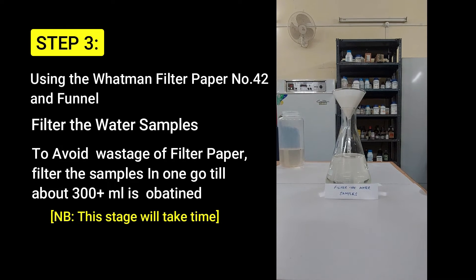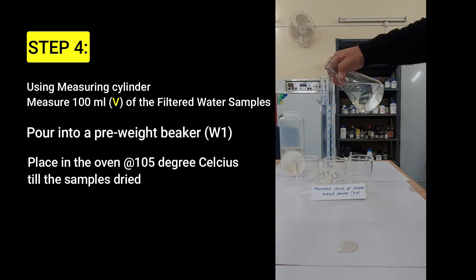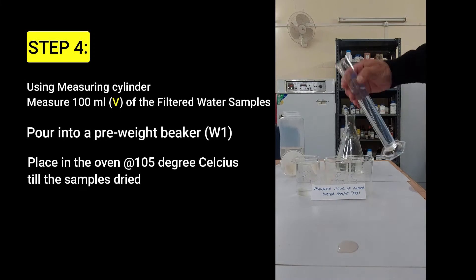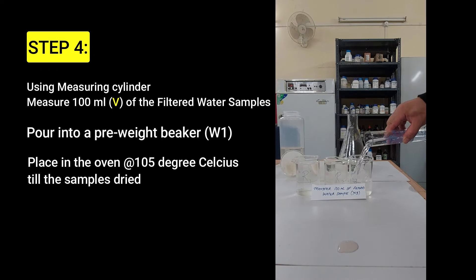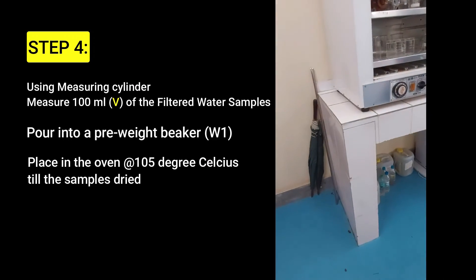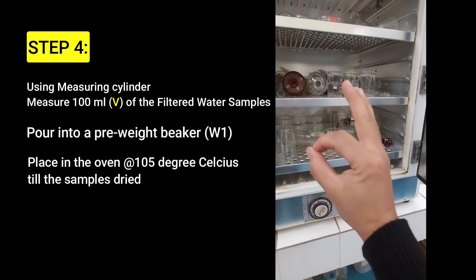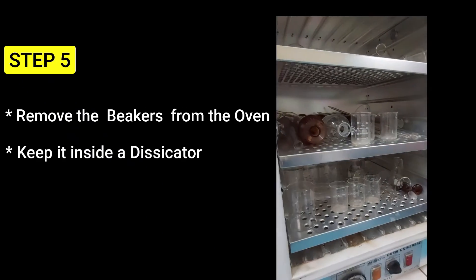Then, using a measuring cylinder, measure 100 ml of the filtered water samples and pour it into the pre-weighed beakers. After that, place these beakers with samples in an oven at 105 degrees Celsius until the water samples evaporate completely. Then wait for 24 hours.